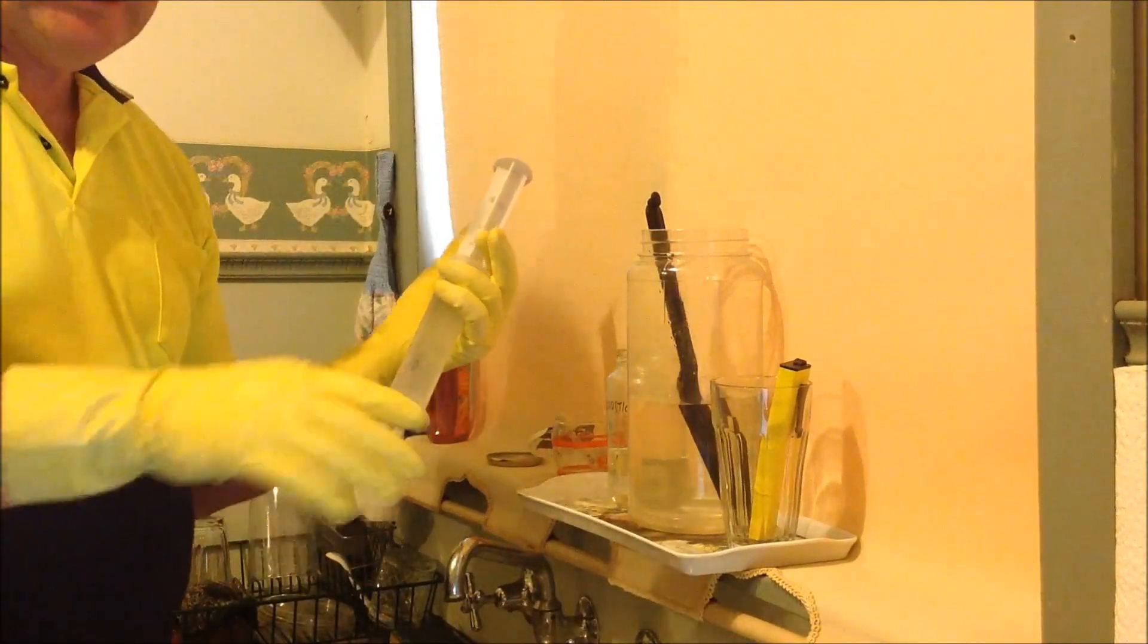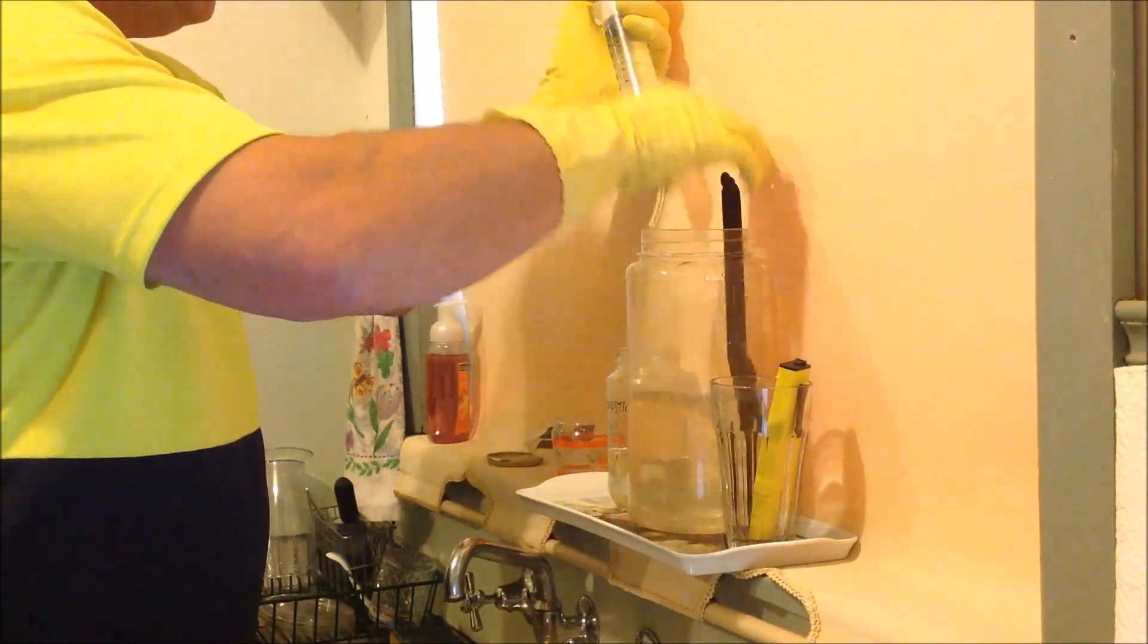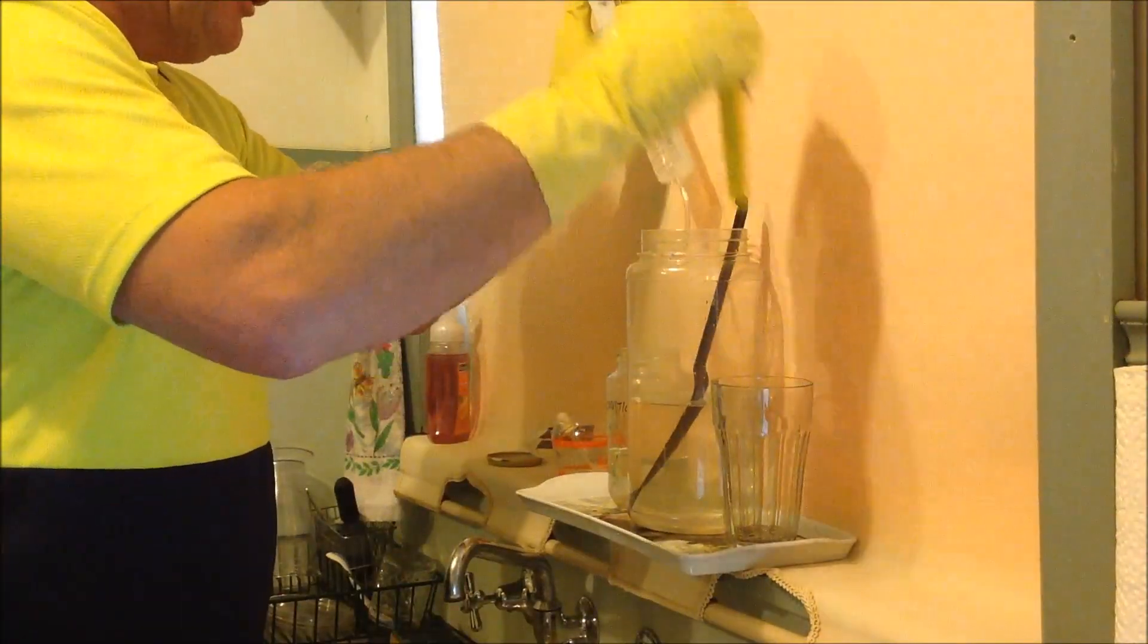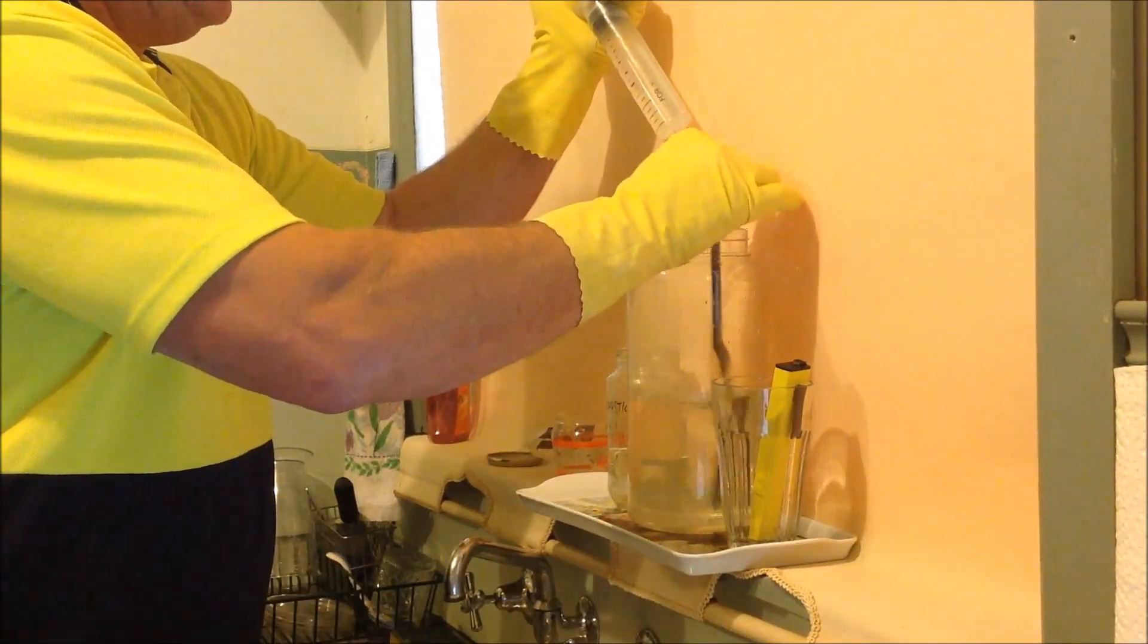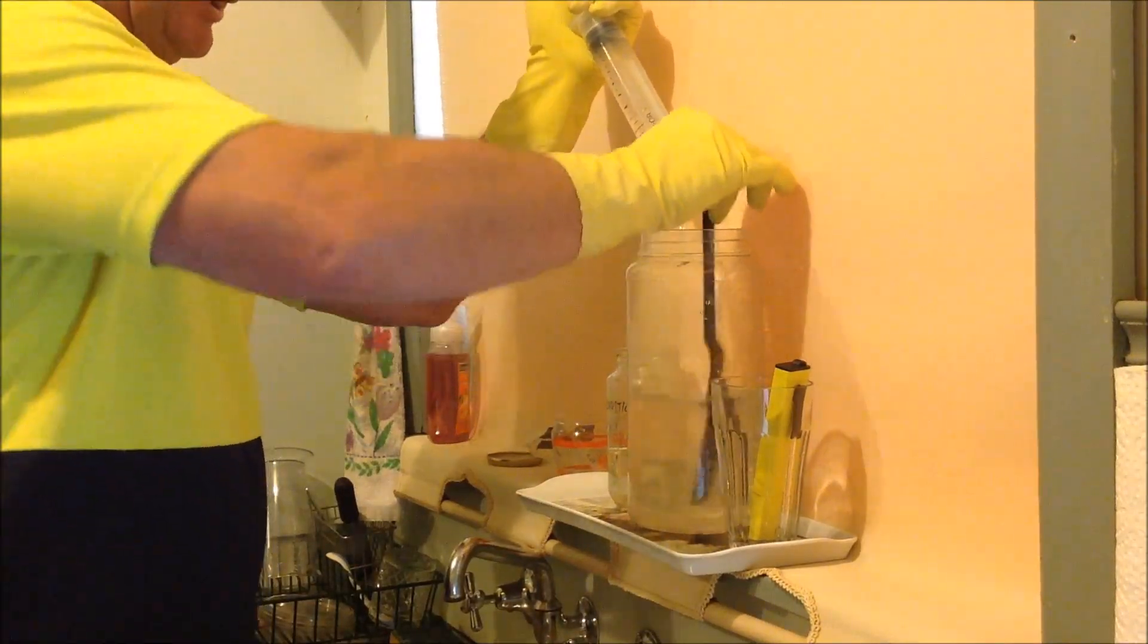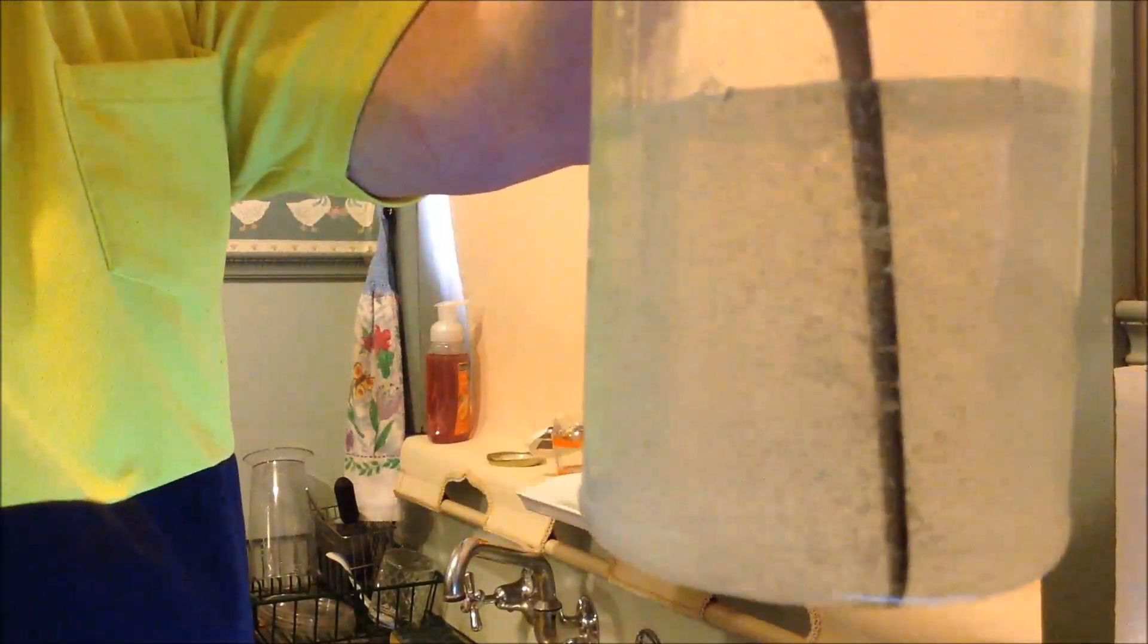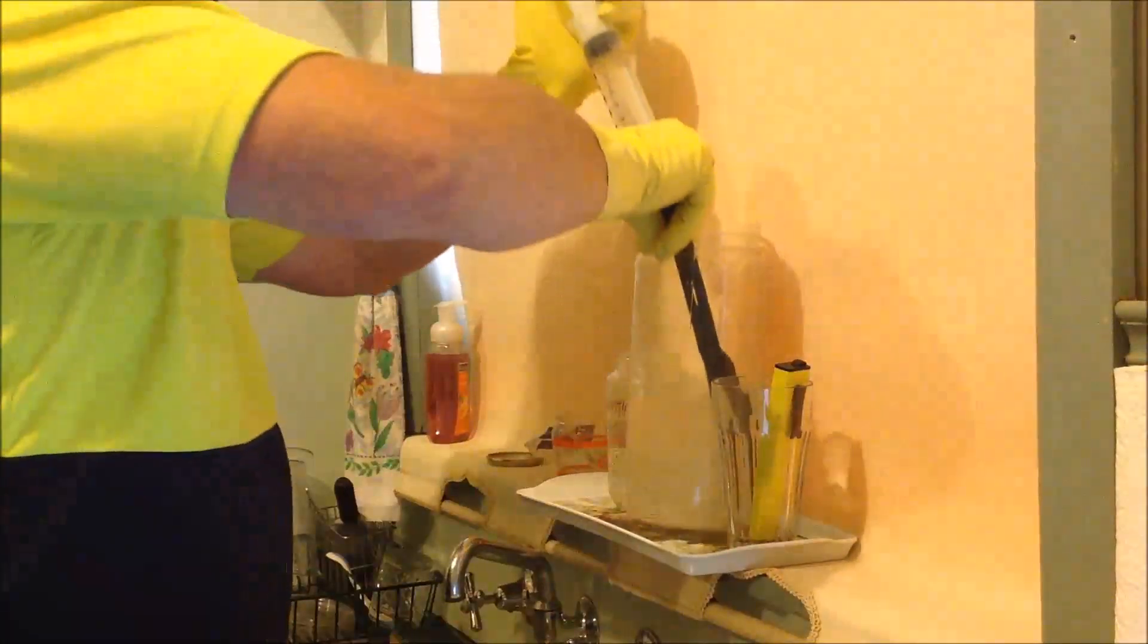Now I will ordinarily stop and take recordings, but I'll just be reading them out and I'll be able to grab them off the video for my graphs which I'll show you later. So we're starting off with 6.5 on the pH meter. If you're really serious, I'm not going to bore the heck out of you by doing this very very slowly, but you may just very quickly see even just with a few drops, there's a precipitate forming in there.